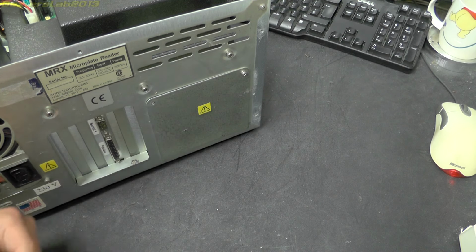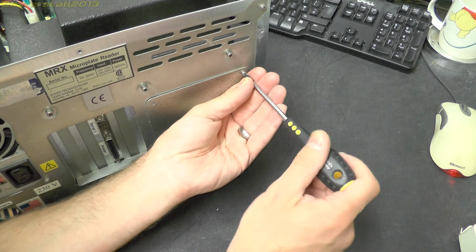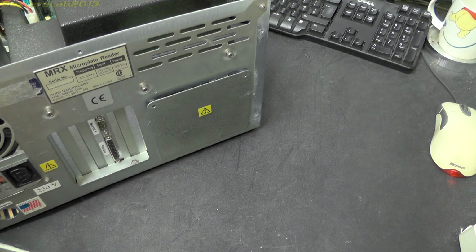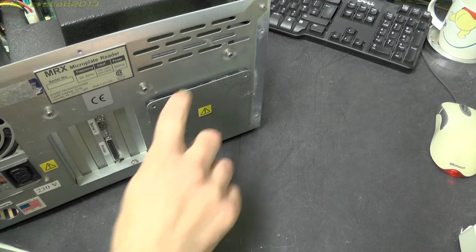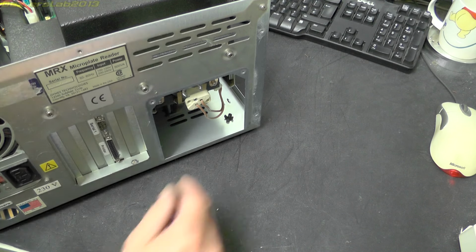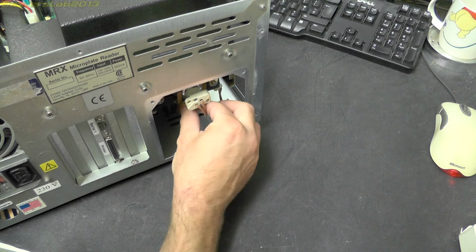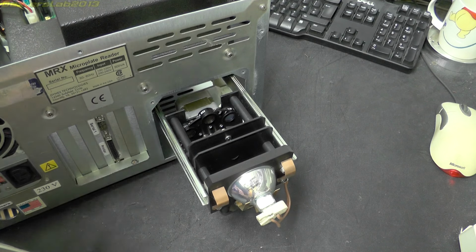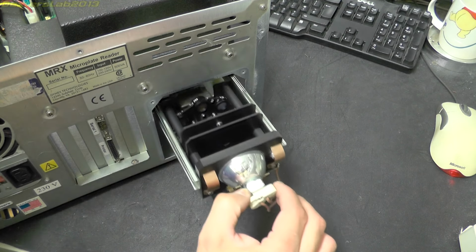See, according to the manual, you can change the light source, or replace the light source I should say, and also exchange the optical filters for different frequencies, different filter properties. So it has a user accessible panel here, so you don't have to take the whole case apart to make those changes. So we just got a pressed steel cover. Oh, right, okay, so we have a slide out mechanism.